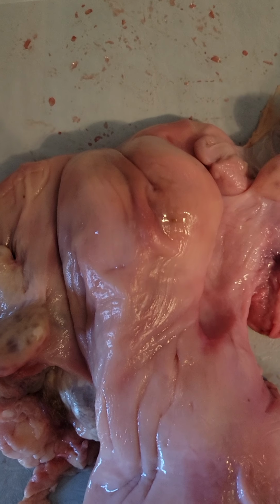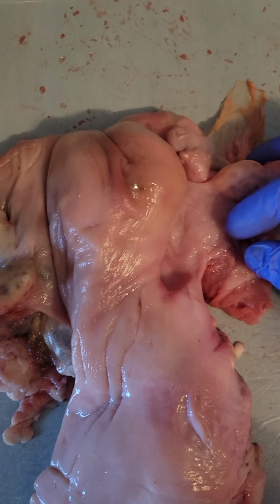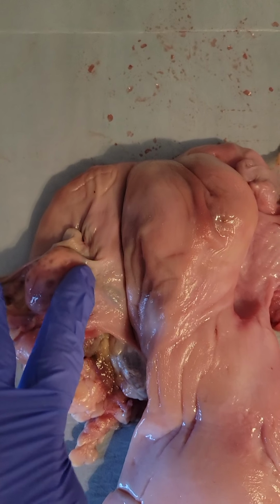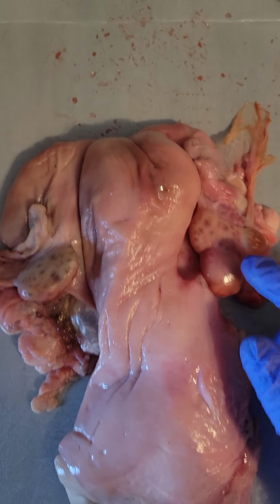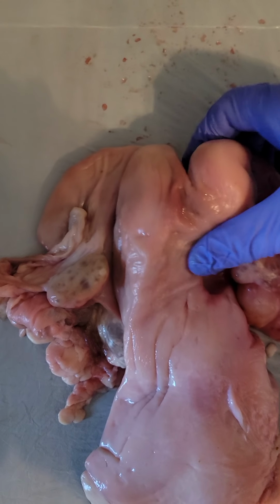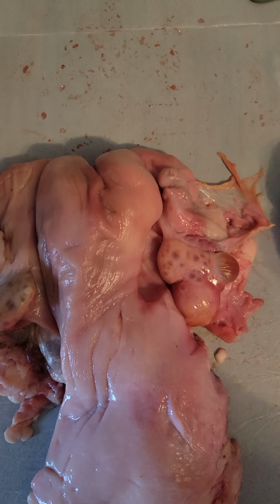albicans. The hilus, which is where it connects to the mesovarium, which is a broad ligament that holds the ovaries on. Hilus on this side. And then I will pause the video to cut this open after I get through the uterine horn, so I can cut both of them open at the same time and only pause once.